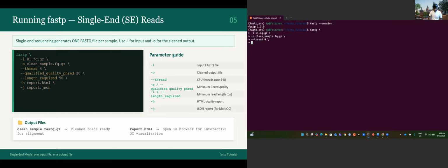And you can also go for the quality threshold. You can just use dash q for this part, and you just specify what is the minimum quality you want. Let's say we want Q20 in that case. And for the length, the same: length required. What is the minimum length required? Let's say I need 50 in that case, 50 bp base pairs. So you can just put dash l.